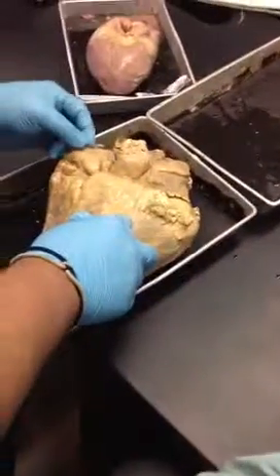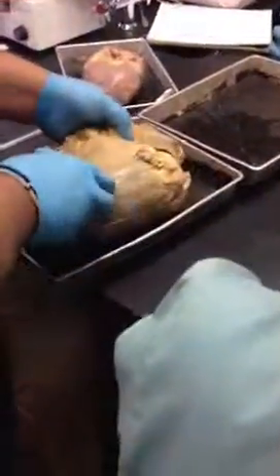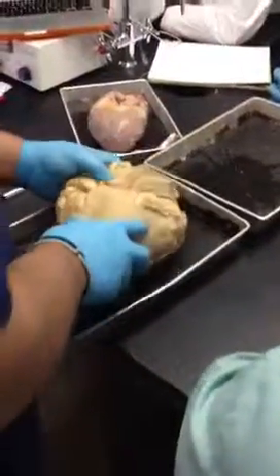Okay? Y'all look good so far? Mm-hmm. All right. Now, posterior view. Is that the back? This is the posterior view. Yeah. And where's the sinus again? Oh, right there. Oh, okay. It's like that.